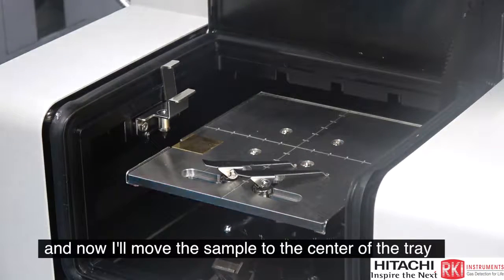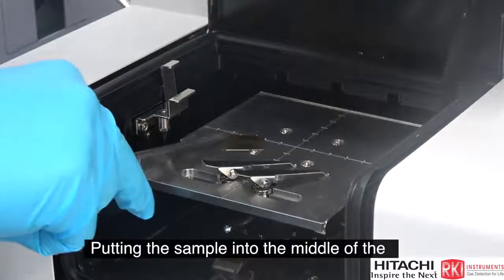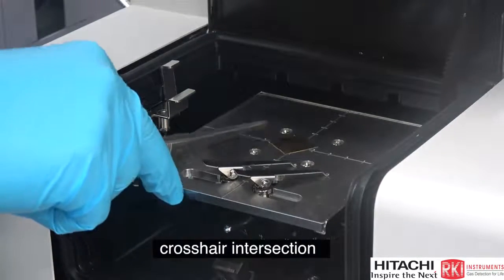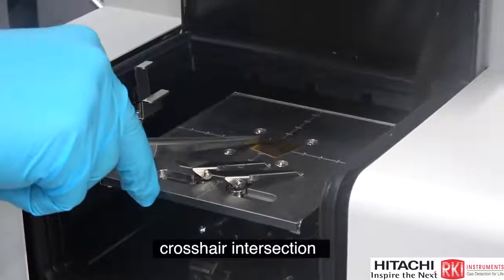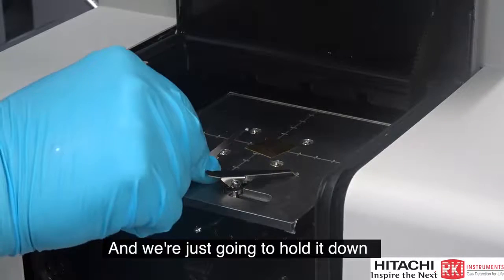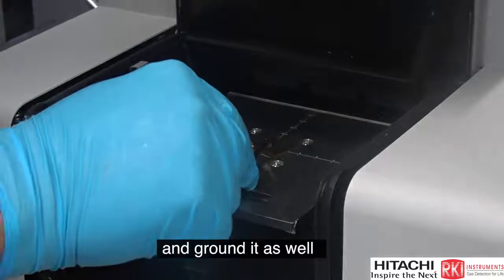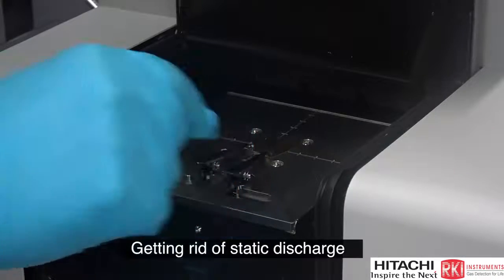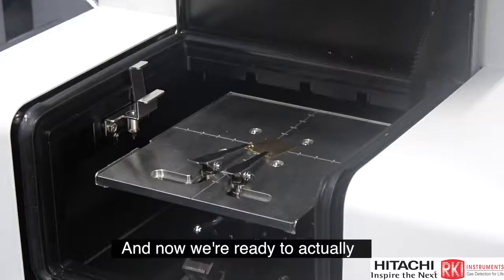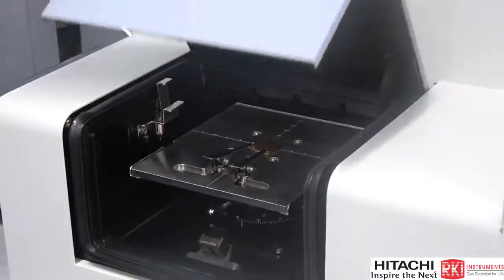And now I'll move the sample to the center of the tray, basically just putting the middle of the sample at the crosshair intersection. Okay, it doesn't have to be perfect, and we're just going to hold it down with these clips, which will hold the sample down and ground it as well, getting rid of any static discharge, as I had mentioned. And now we're ready to actually run the sample through the program sequence.